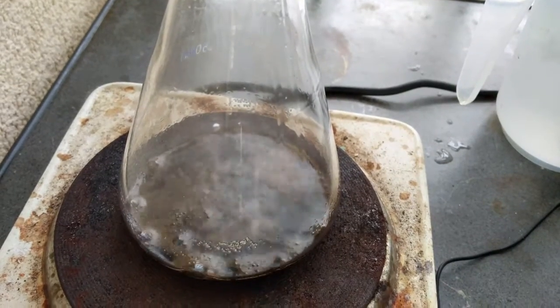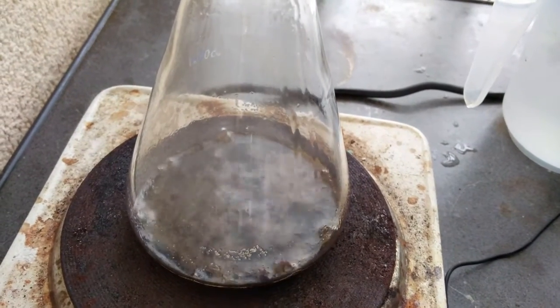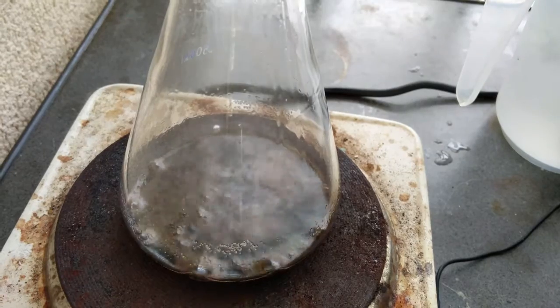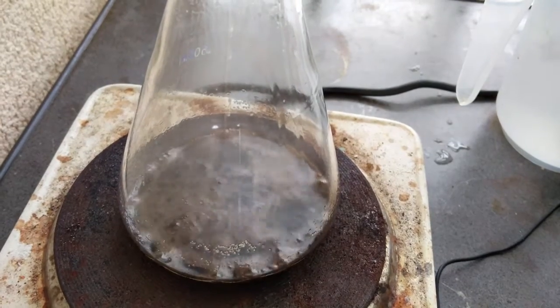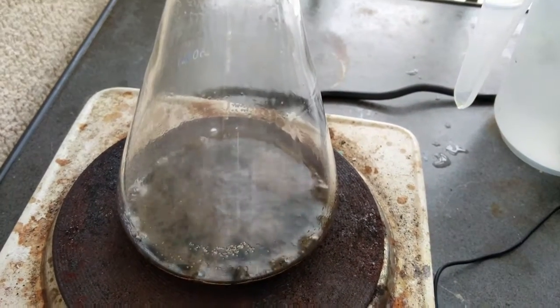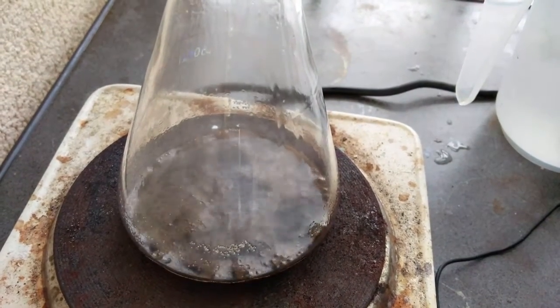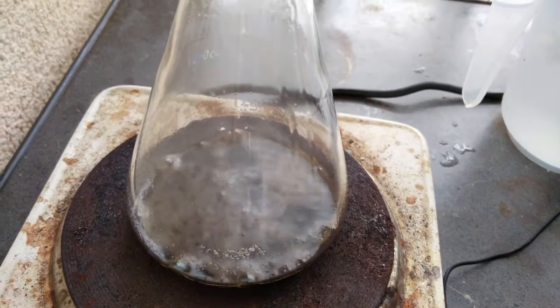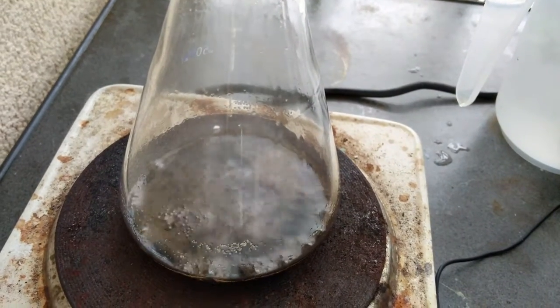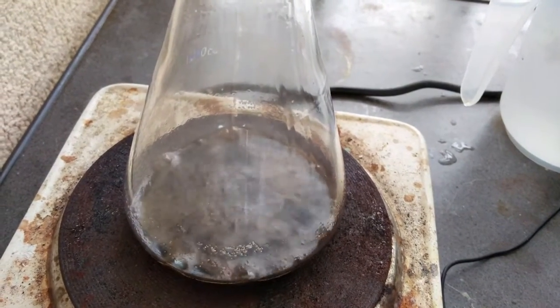Today I'll be making formic acid from oxalic acid. Formic acid has a variety of uses in organic chemistry, like forming esters. Unfortunately I didn't find a source where I could buy it, so I have to make it myself.